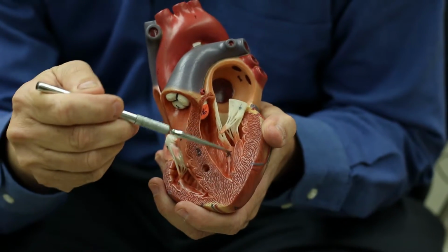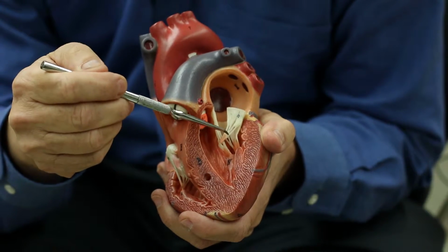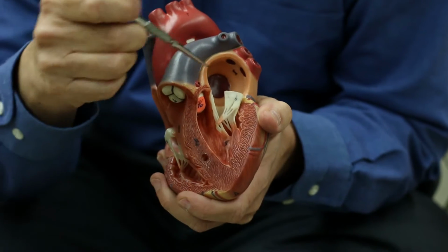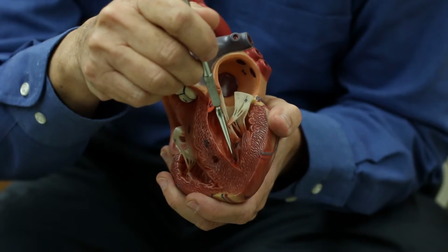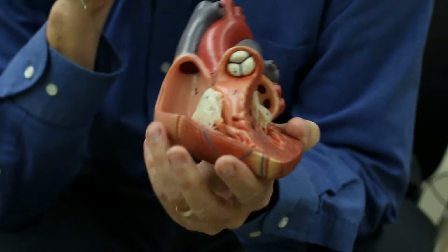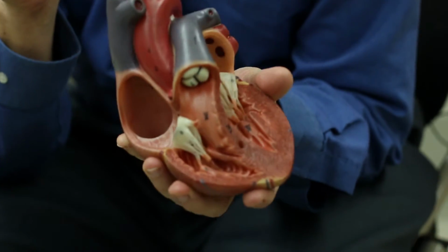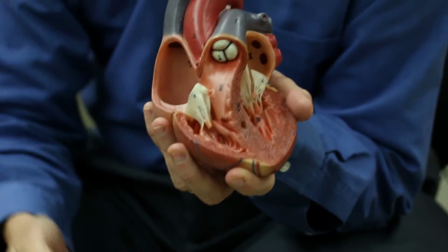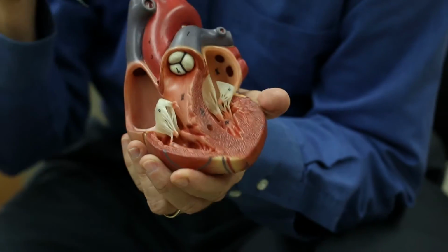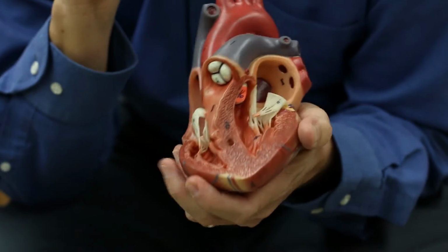You can see here the papillary muscles. Again, papillary muscles in conjunction with the chordae tendineae here and the cusps open and close this valve, controlling the flow of blood from the atria into the ventricle. Now, you can also see what are called semilunar valves. These are a little harder, and when you open it up, you'll probably have a hard time seeing them. We'll have to come down and look straight down these blood vessels to find those a bit, or make more cuts.